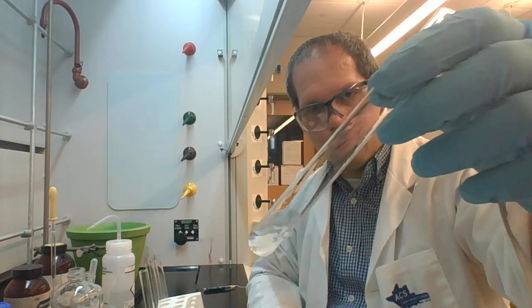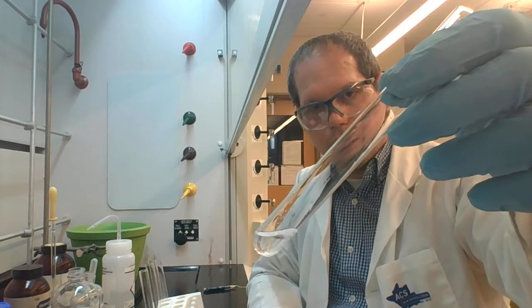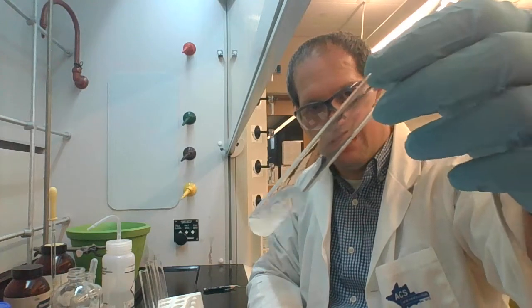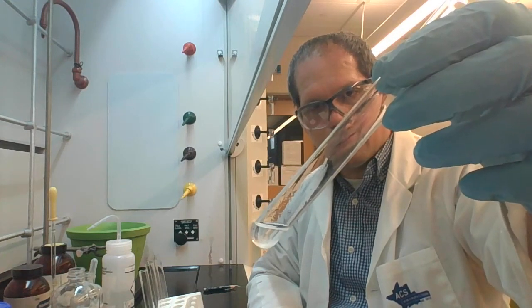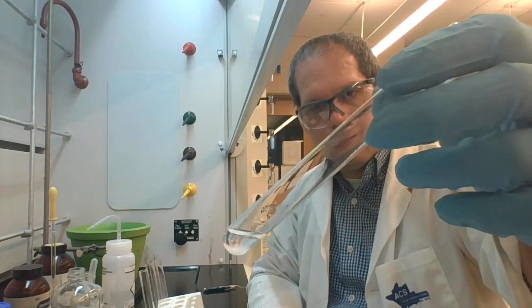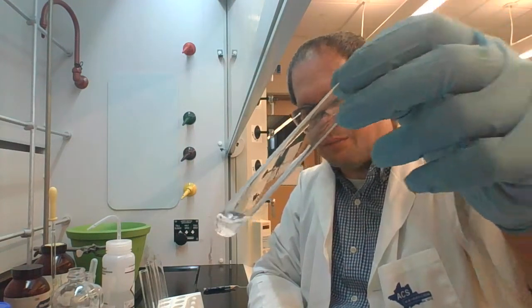So when we mixed methanol with fluorene, we sort of find a similar result as hexane. It looks like some of the solid has perhaps dissolved, but not all of it. There's always a little bit that settles at the bottom. So at best, this is partially soluble, and I think that's actually what we have here.